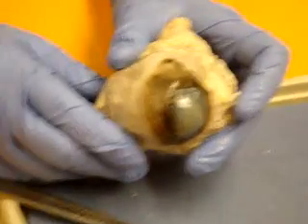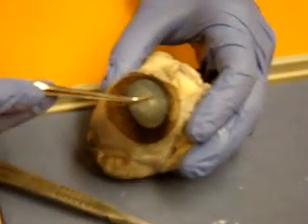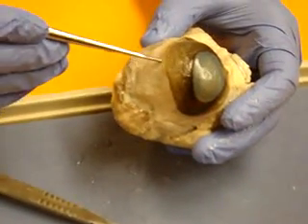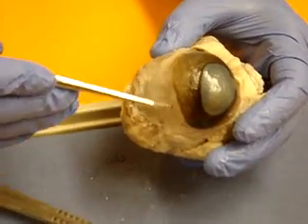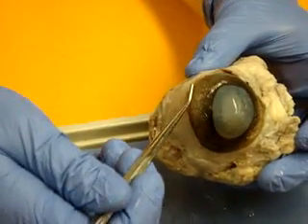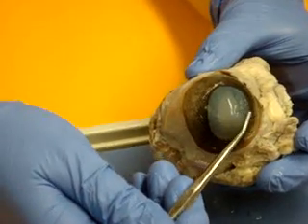So here is a sheep's eye. This is the cornea. This back here, this white part, is your sclera. The fibrous tunic is made up of the sclera, and then in the front it continues into the cornea.